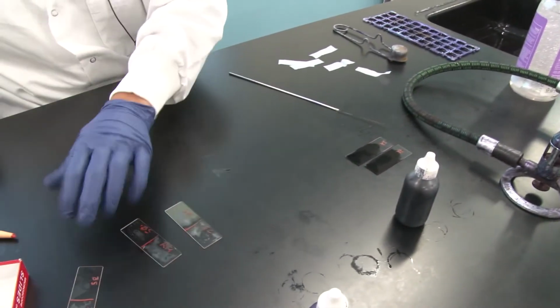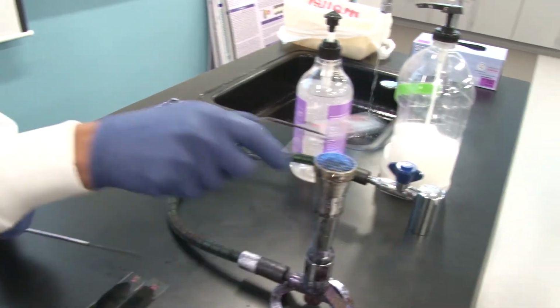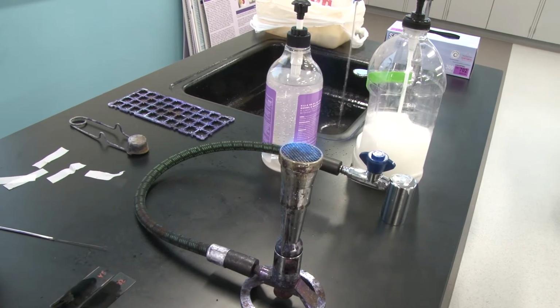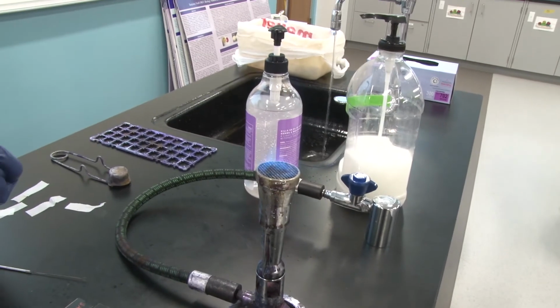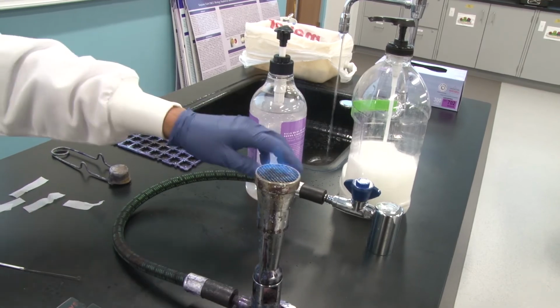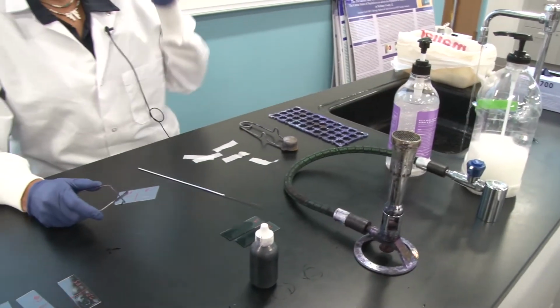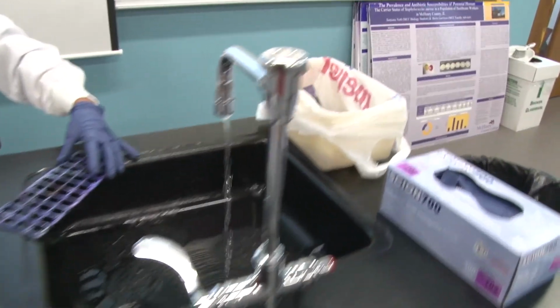So here I go again, heat fixed. We'll do this again quickly for our other set. And again, it is so rapid. 1, 2, 3, 4, I'm done. That's all you have to do. Final set here. 1, 2, 3, 4. I am ready now to stain. I do not need this flame on anymore, so I'm going to take that off. I'm going to take my goggles off once I've turned off the gas.